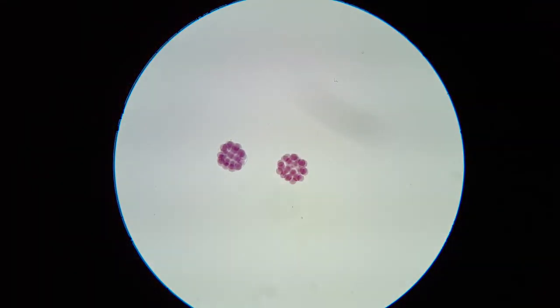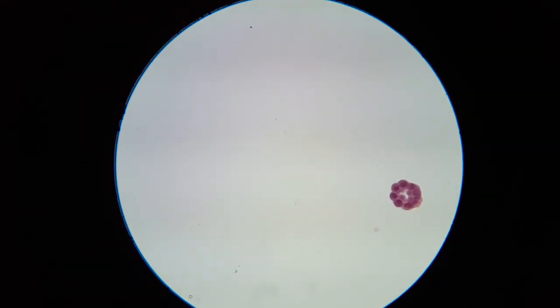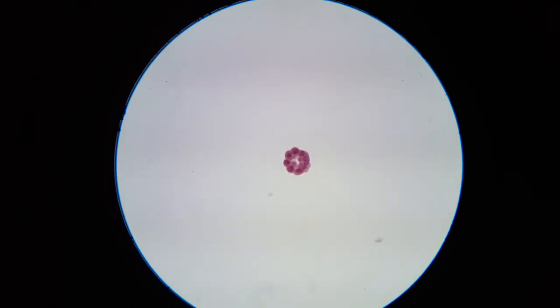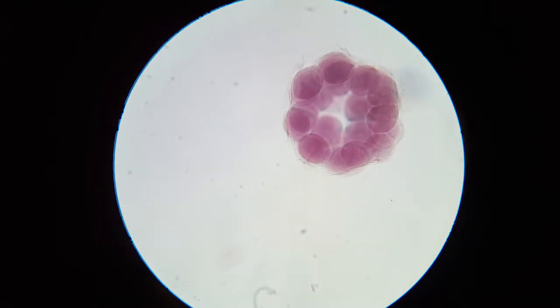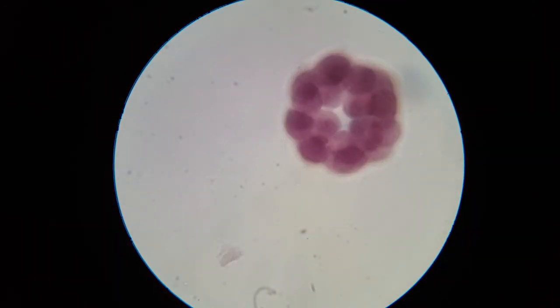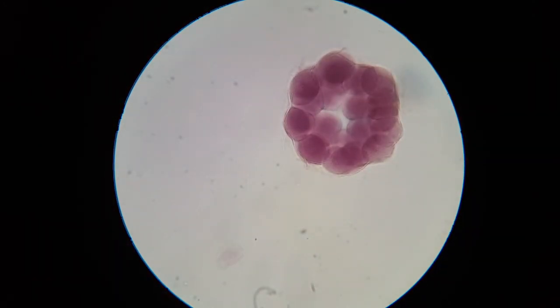The slide says Starfish 32 Cells. This one looks very similar to the one we were just looking at — so Starfish 32 Cells. Now we're looking at the Starfish Gastrula.